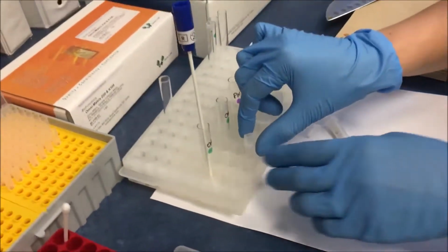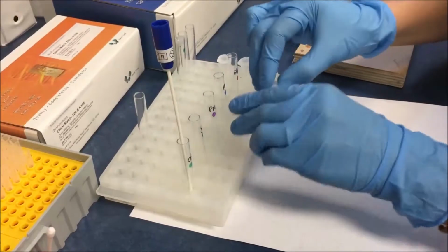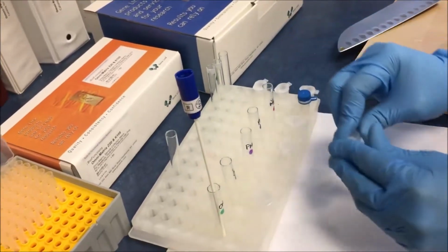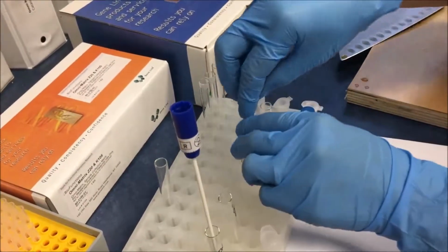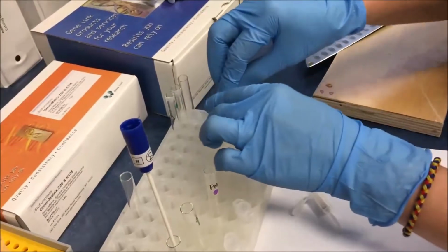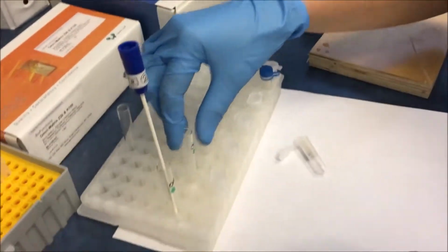Now we are going to transfer the samples which came in the Eppendorf tubes into each one of these glass tubes. Normally in the lab they will not be transferring it, they will straight away add the lysis buffer into the microcentrifuge tube. The only reason we are transferring it today is for demonstration purposes to show you how the Omni-Matrix compares with the swab. With the swab, this is after like 2 to 3 minutes.